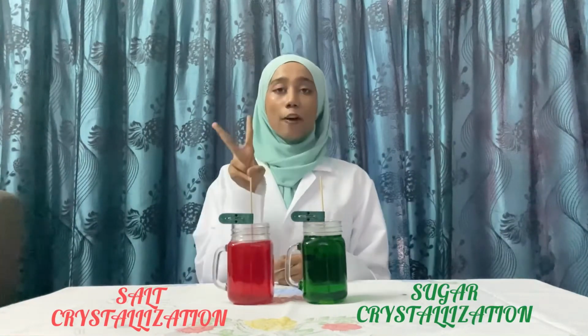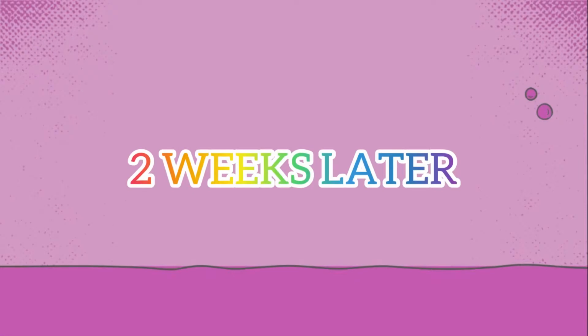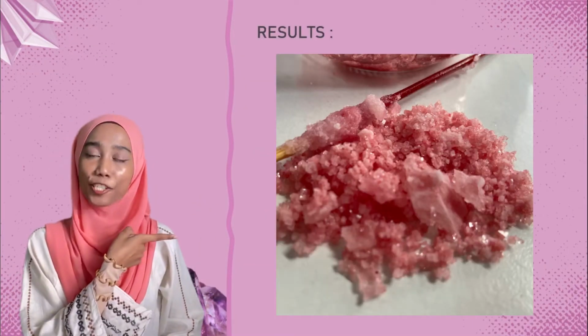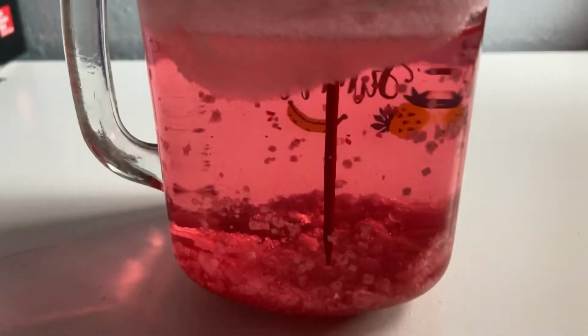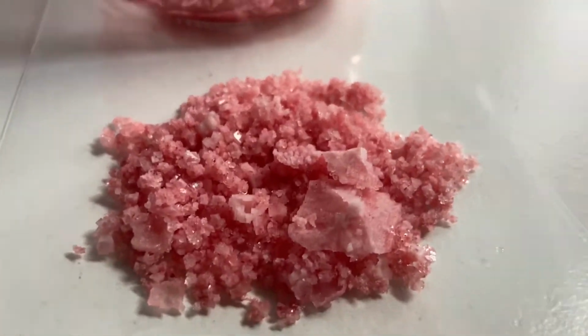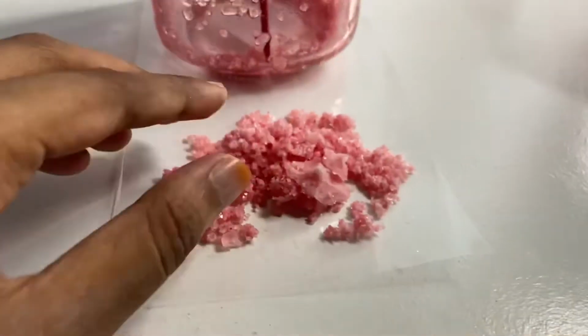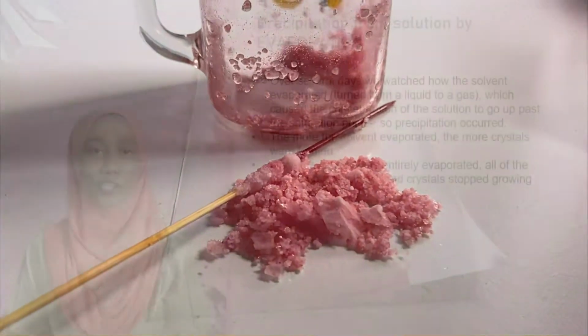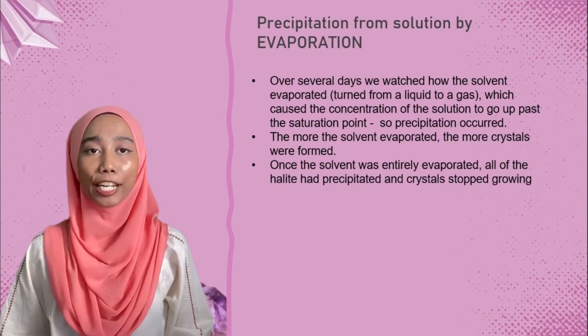So we just wait 2 weeks to see the result. 2 weeks later. So now we discuss. This is the result of salt crystallization. Salt crystals formed by evaporation.